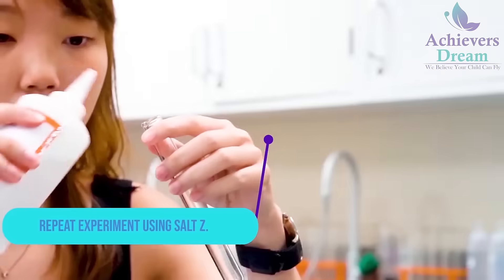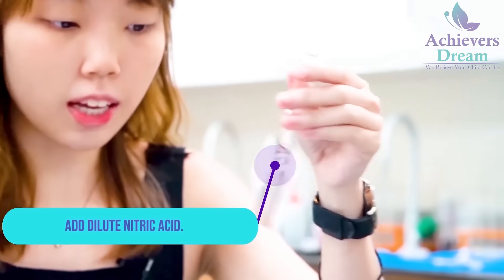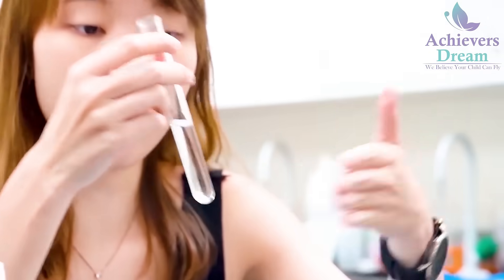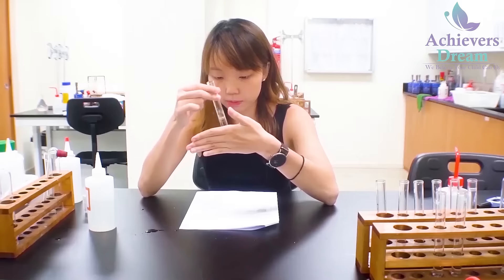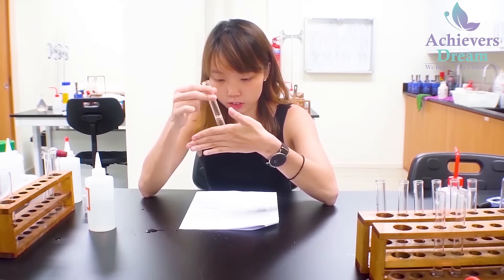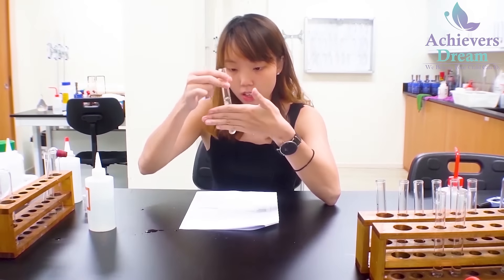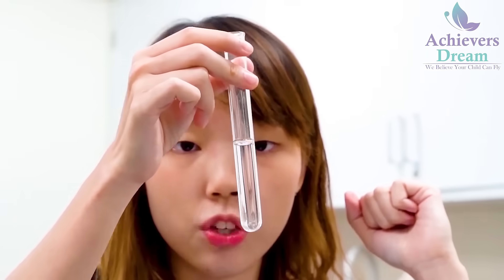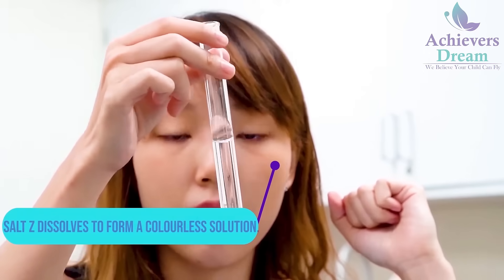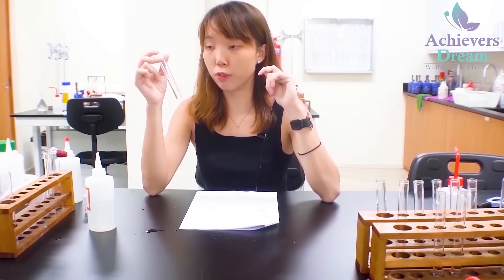I'm going to repeat it for salt Z. I'm going to add in nitric acid. When I add in nitric acid, you'll see that there's no effervescence, and your salt Z has dissolved in nitric acid to form a clear colourless solution. This is your observation for salt Z.